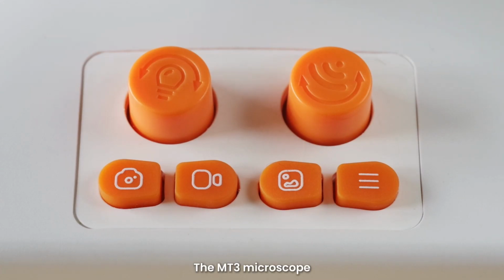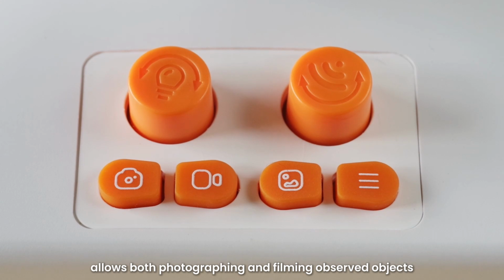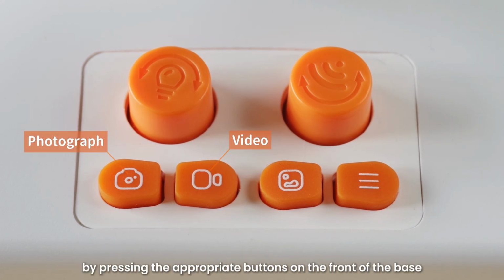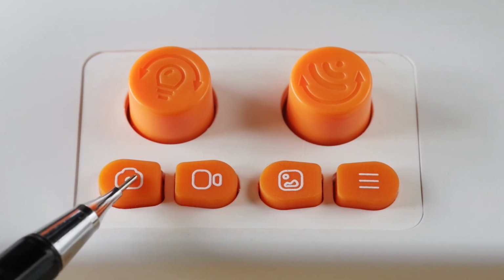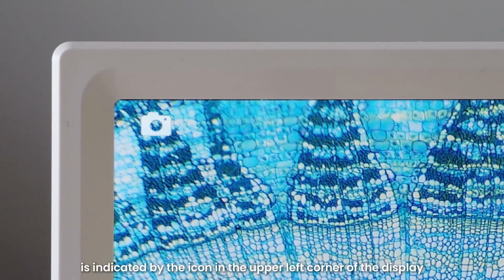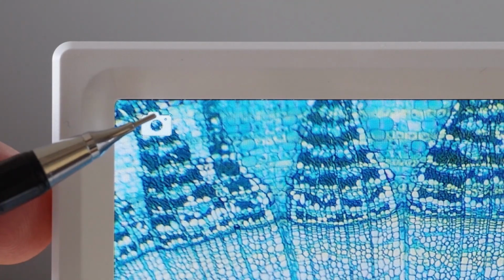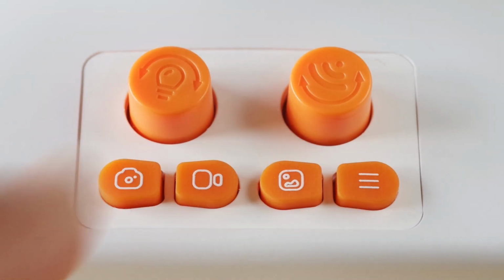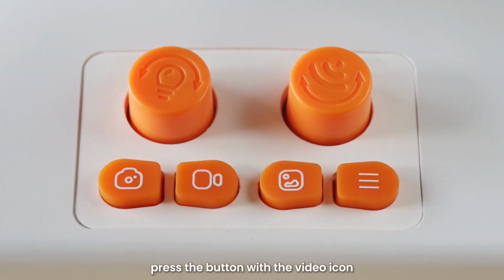The MT3 microscope allows both photographing and filming observed objects. We select the shooting and filming functions by pressing the appropriate buttons on the front of the base. The selected image recording mode is indicated by the icon in the upper left corner of the display. To take a photo, press the button with the camera icon. To start filming, press the button with the video icon.